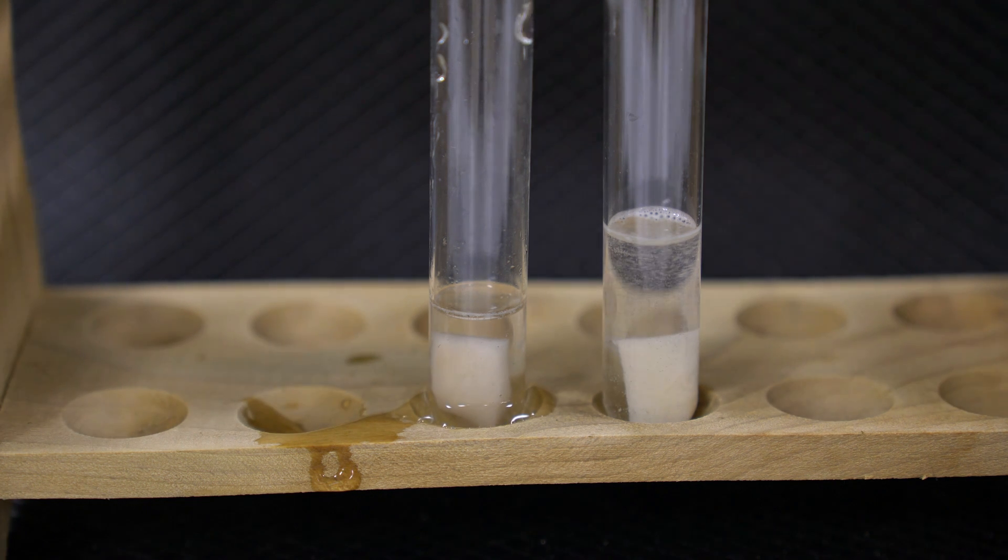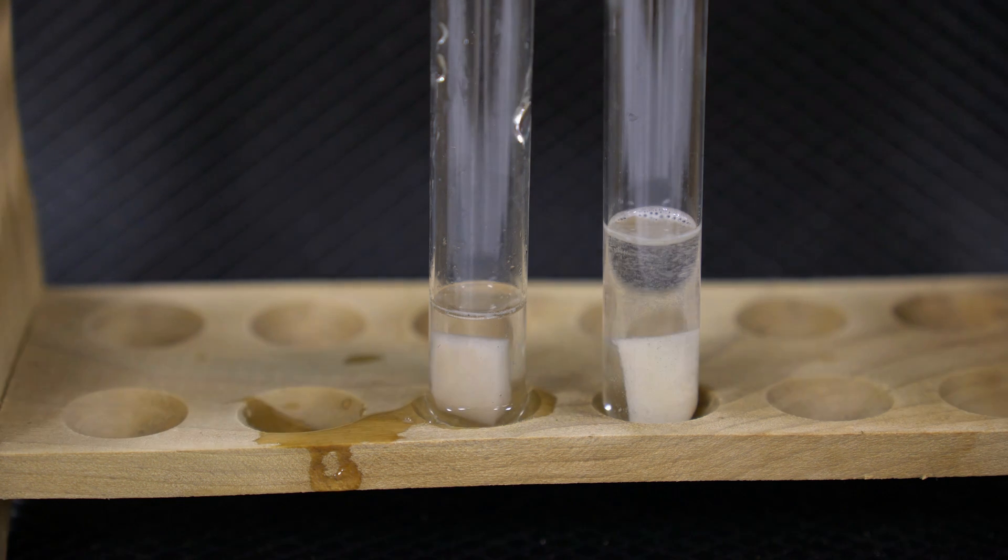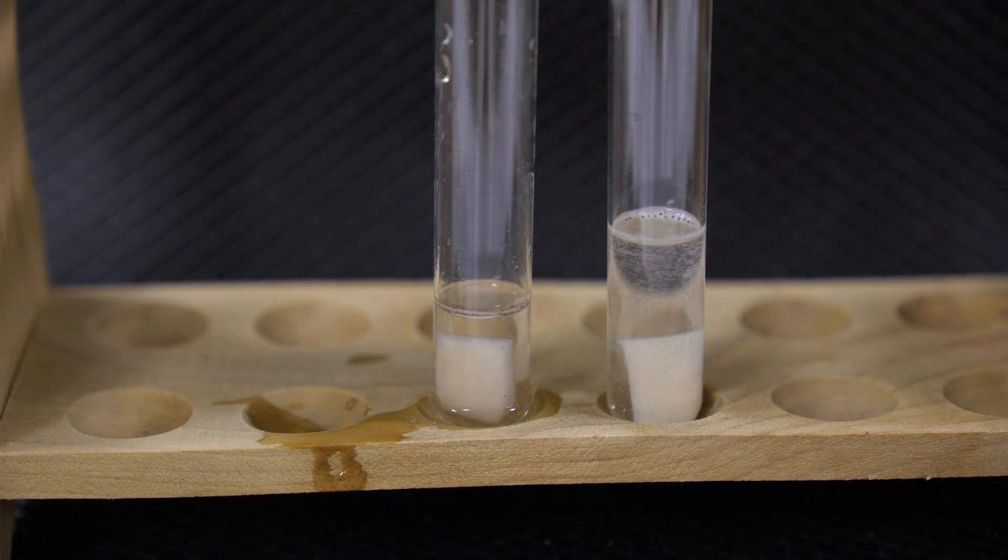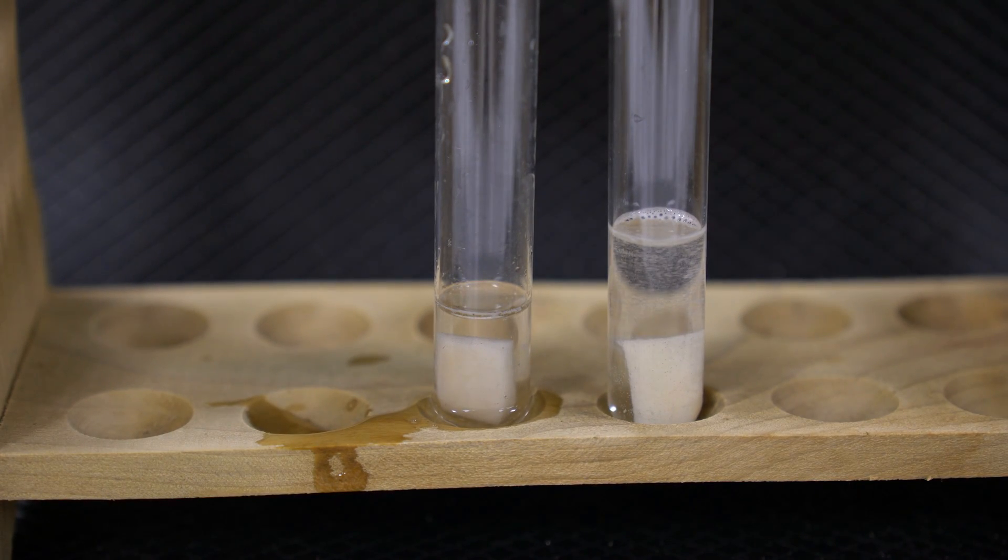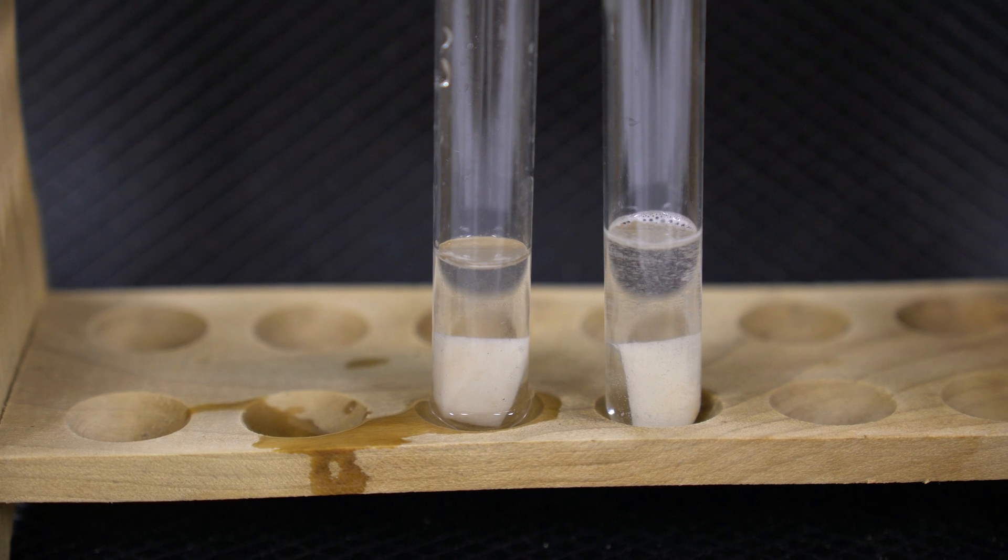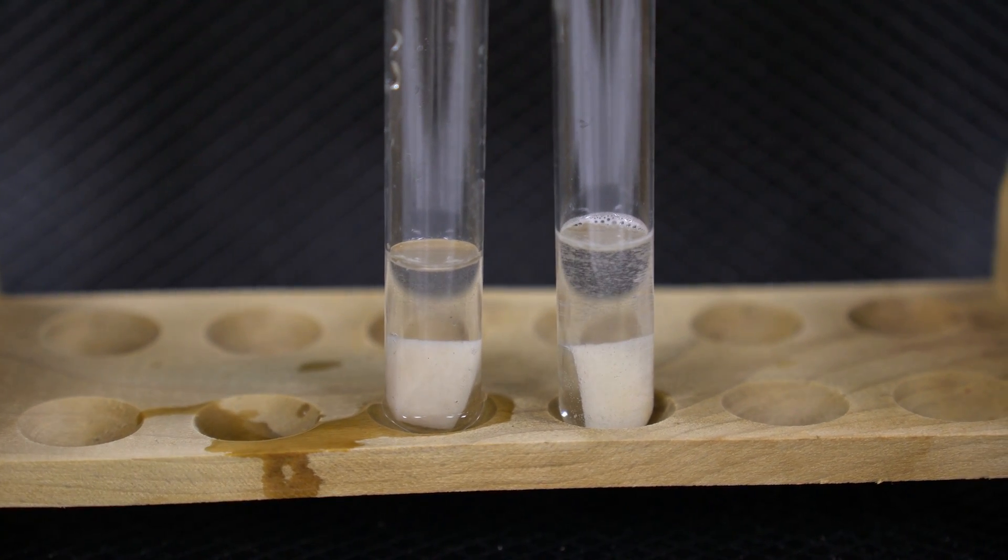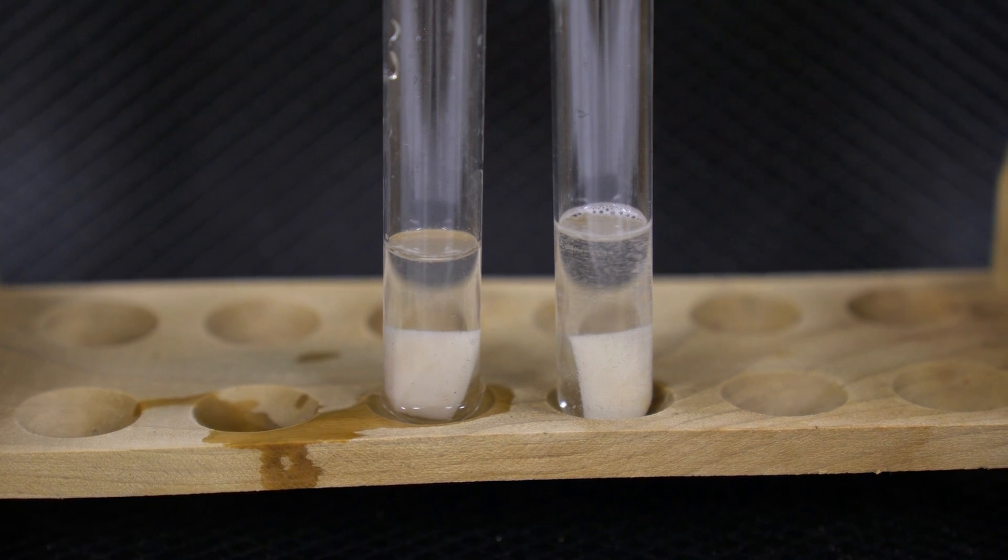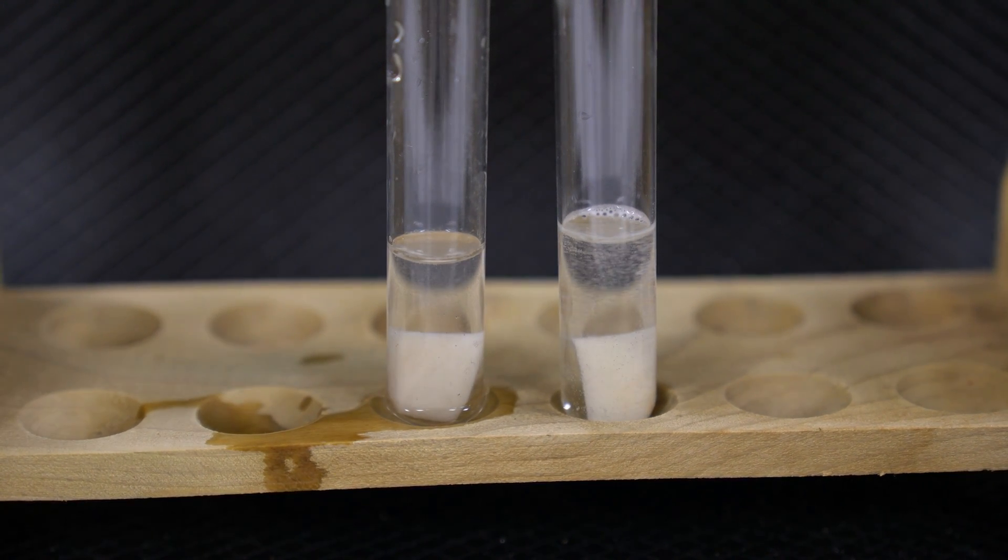As we can see, I spilled just a little bit. Looking very closely, just a little bit more to make sure they're even. So now if we're looking at the reaction, we too see it reacting, but very slowly. Compared to the initial reaction, you can see that is definitely much reduced. If we do a quick comparison with a normal potato, we'll see that there is a difference.